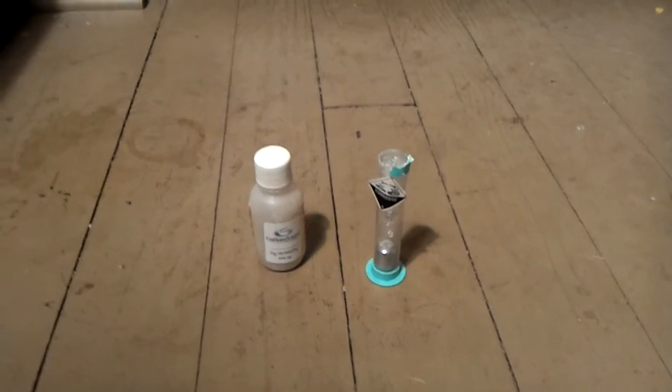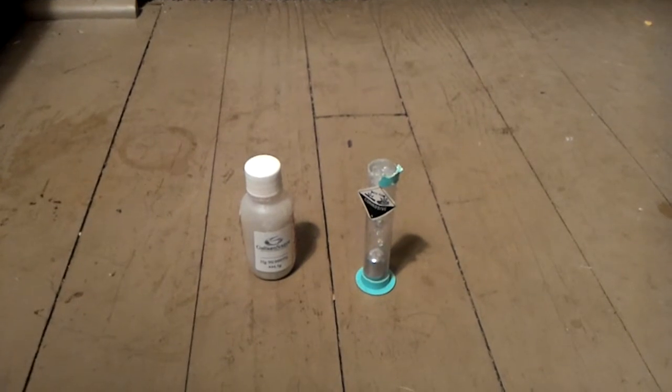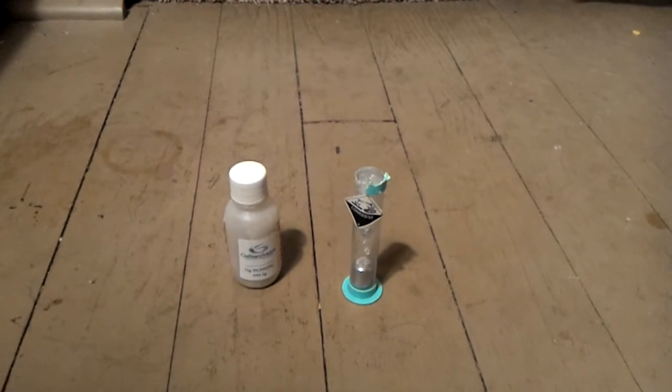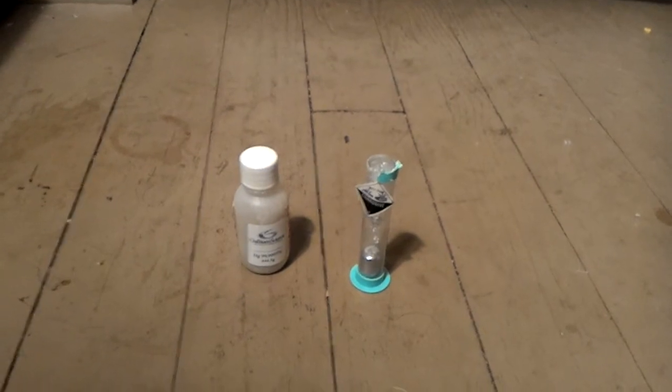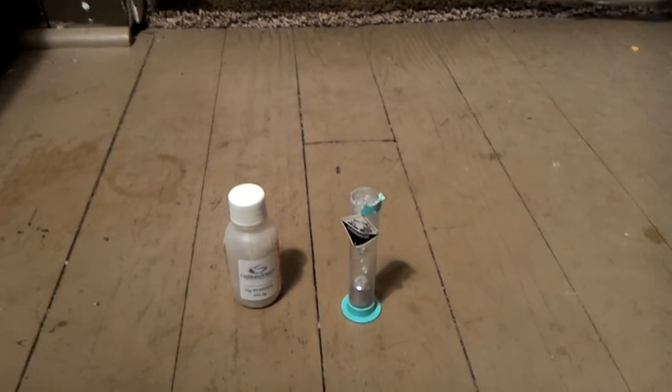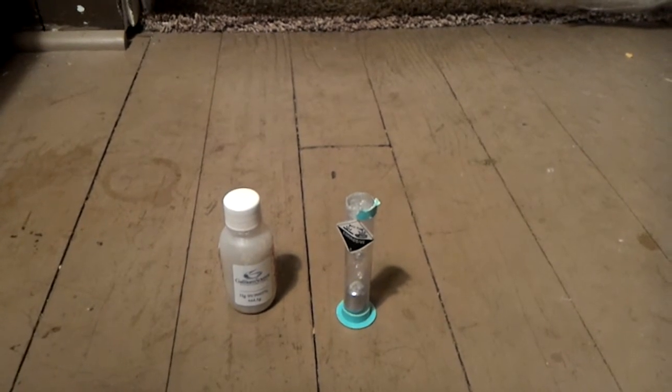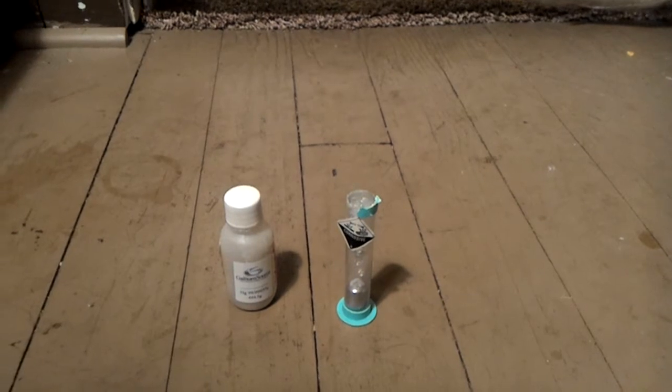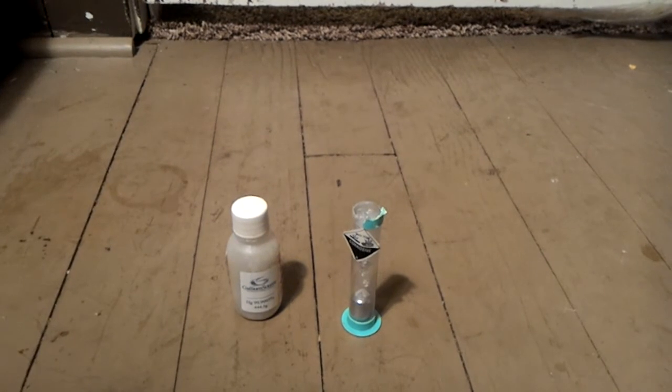Well, I tried acid. I tried hydrochloric acid. Which wouldn't react with mercury normally. But, you need, the problem is you need hydrochloric acid with no oxygen dissolved in it. Which is kind of hard to do. For, if you're trying to go cheap. So, it'll eventually surround the mercury in this nasty white sludge. Which is probably mercury chloride. And that's definitely not good to touch. That's a mercury salt. And that can damage your nerves.